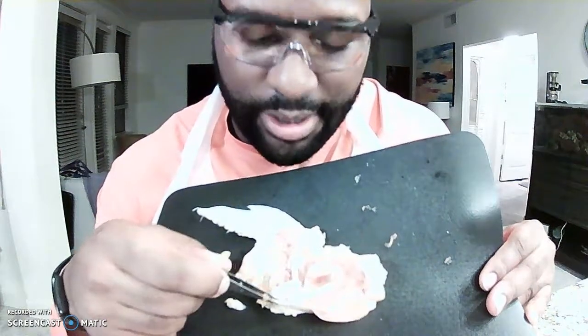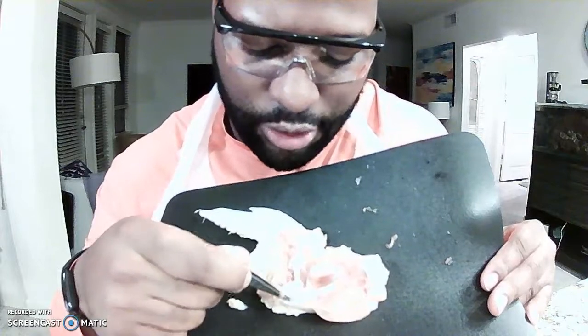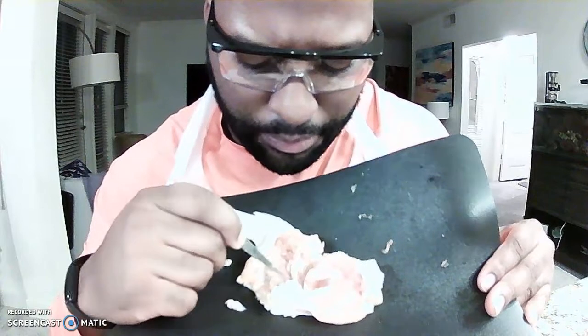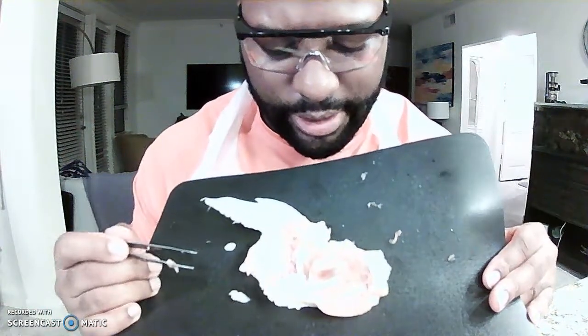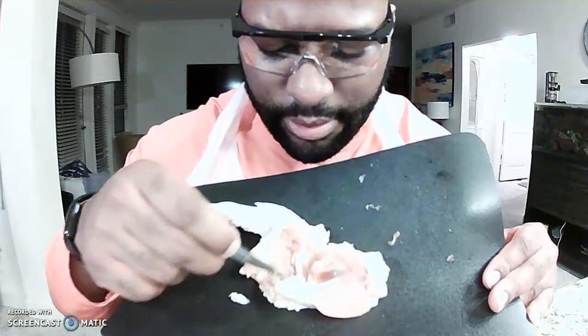But obviously we don't see that here because it's out, it's been open. But this is where it would be within this joint. You can see a little bit of the other bone in there too. Yeah, that is the chicken wing. I think that's it. Bone, bone, bone, joint, membrane, synovial fluid, synovial joint.